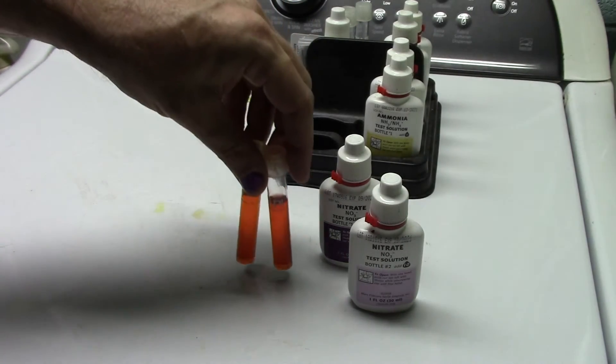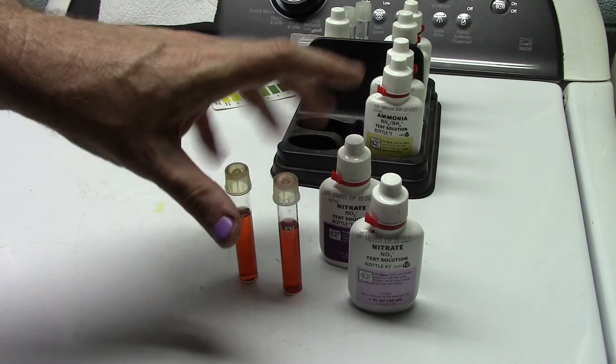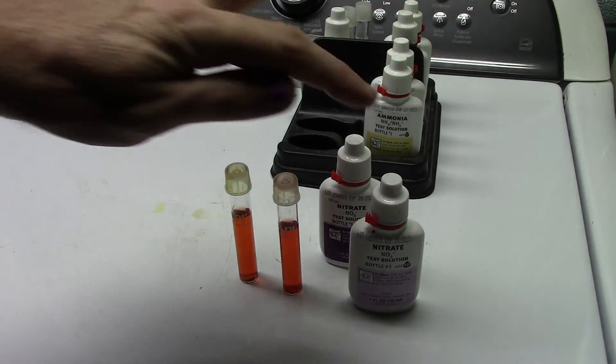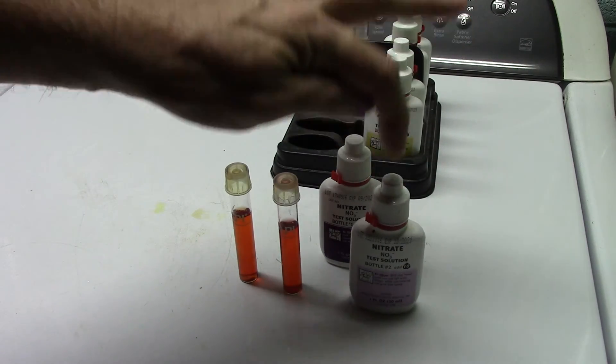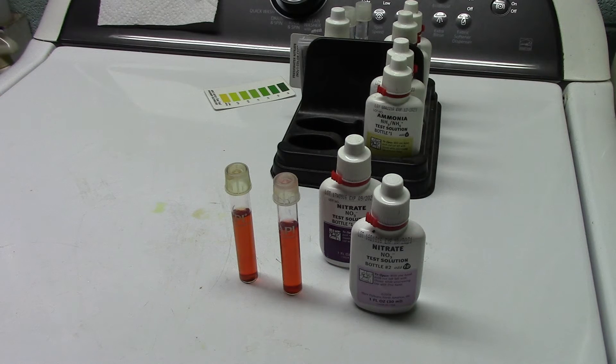So you do not have to vigorously shake that vial after you have put your second reagent in. You do have to vigorously shake this vial every time you use it. You've got to get that little granular stuff in there broken up and evenly dispersed and suspended in the thick solution that's in there.